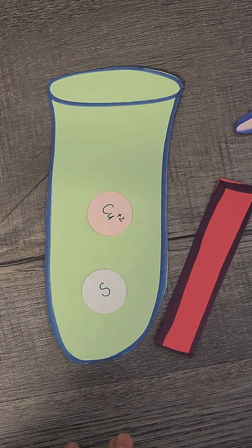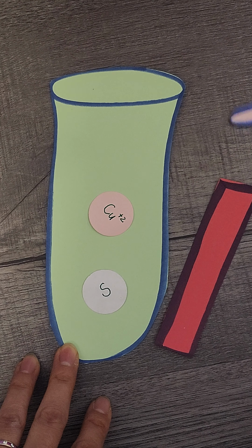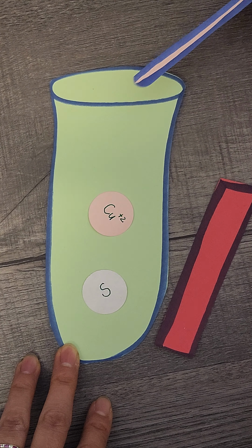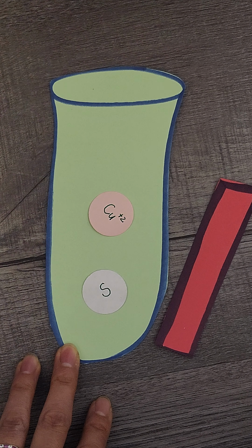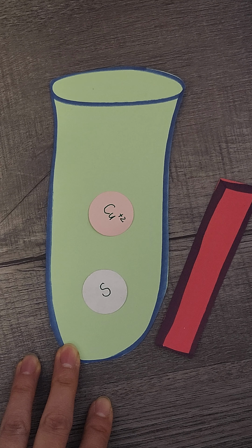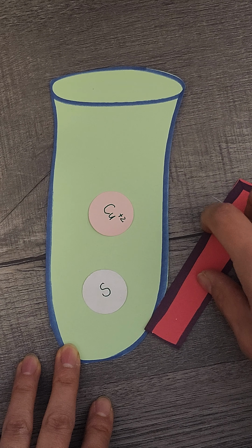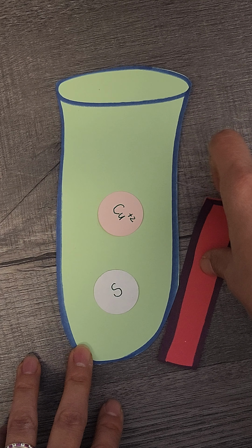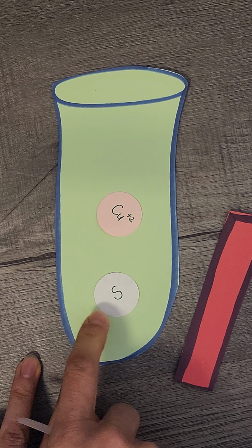So here you go. Add some base, dip, and then dab onto the red litmus paper. If it's not turning blue, add a little more base, get a stirring rod, dip, and then onto the red litmus paper. After this becomes blue, you're going to add in even more base, and then observe this, take a picture of this, and you should be done with part B.